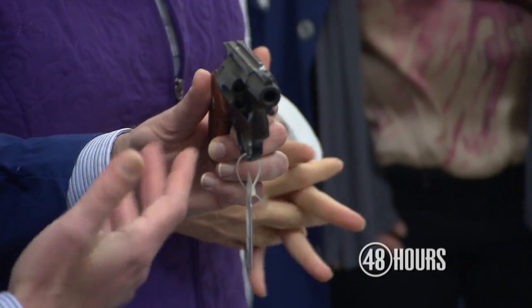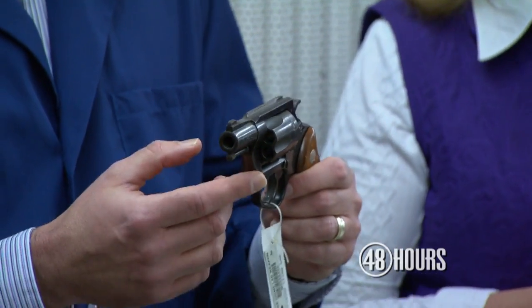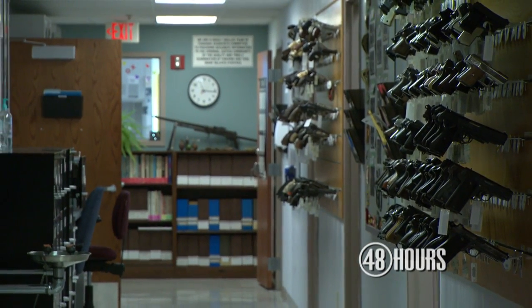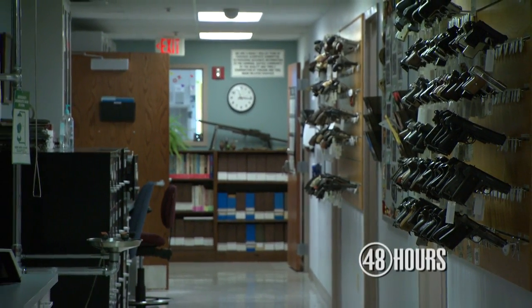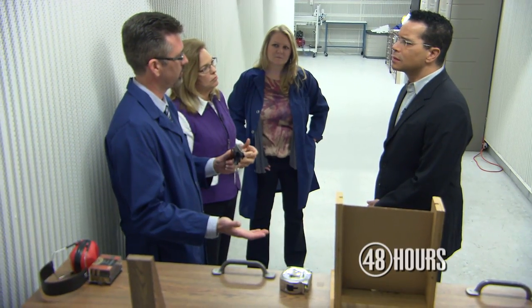This particular revolver is not the one that was collected for evidence. When we did the actual testing, it was indeed the revolver submitted by the law enforcement agency that was collected at the time. This is actually a firearm from our laboratory collection — we keep a firearms reference collection.